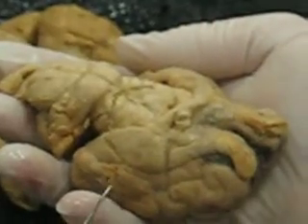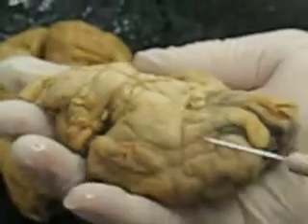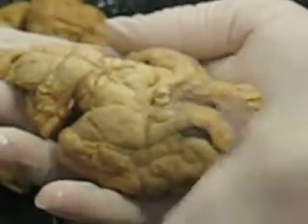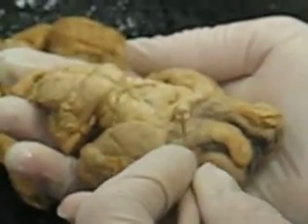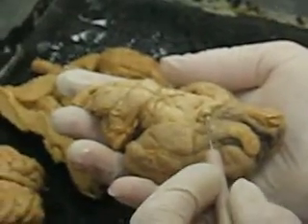The optic nerves, well, these are cut pretty short. The optic nerves actually come off the back of the eye. This one here is the left one, so it goes over here. The right one comes over here, and then they cross over to opposite sides of the brain. Optic tract, it just extends forward. The optic tract has the same name as a nerve, but it's more technical. Just call it optic nerve.